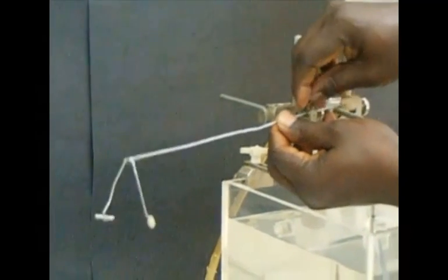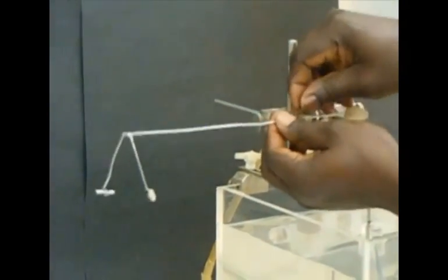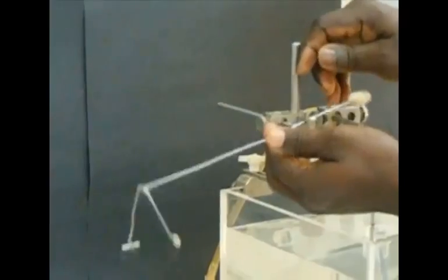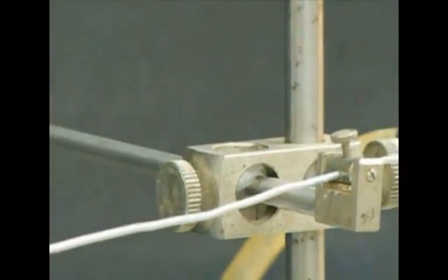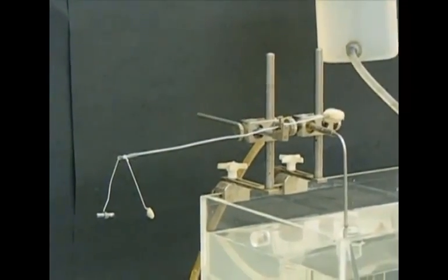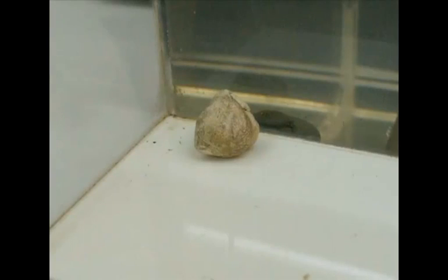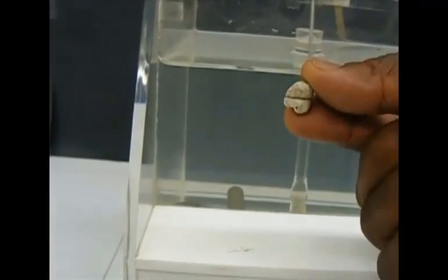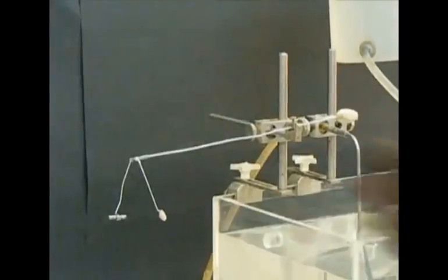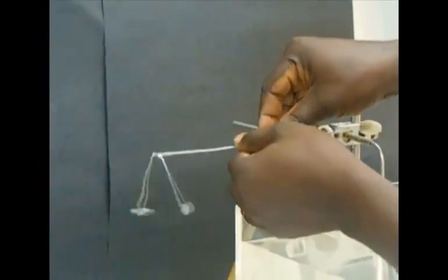Balancing the writing lever: It is ensured that the writing lever is balanced with approximately one-fifth of the length of the lever on the plasticine end and four-fifths on the writing pen end. After the lever is balanced, a little plasticine is placed on the writing end at approximately the same distance as the balancing plasticine, but opposite in direction. The writing lever is then set for recording.